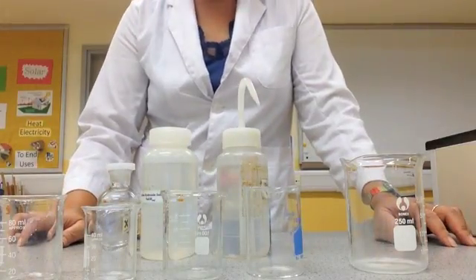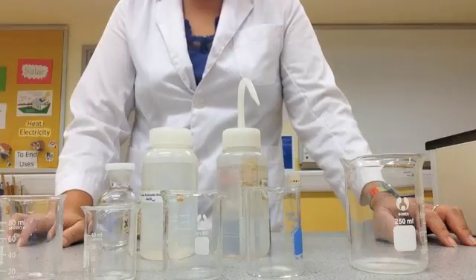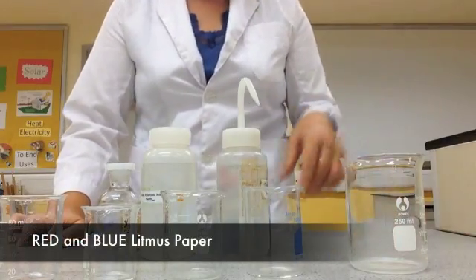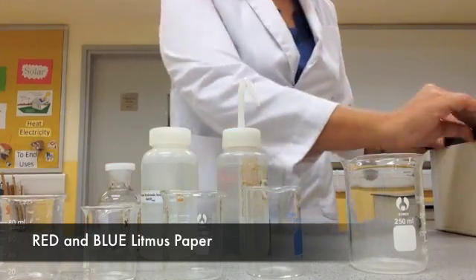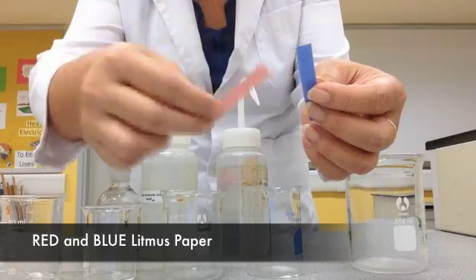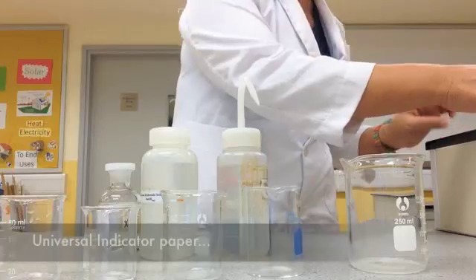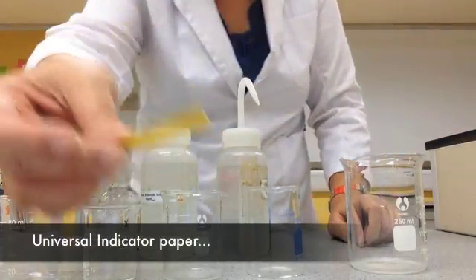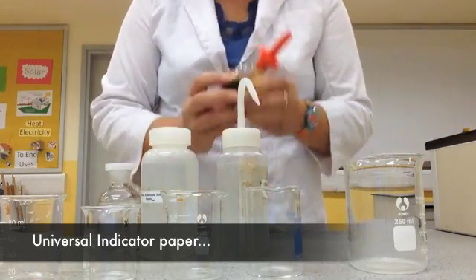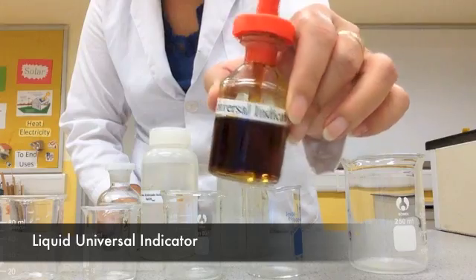Welcome back. Now I'm going to show you a video about indicators. As you know, we have different kinds of indicators. We talked about litmus paper — the red one and the blue one. We also talked about the universal paper indicator, which is yellow, and the liquid universal indicator.